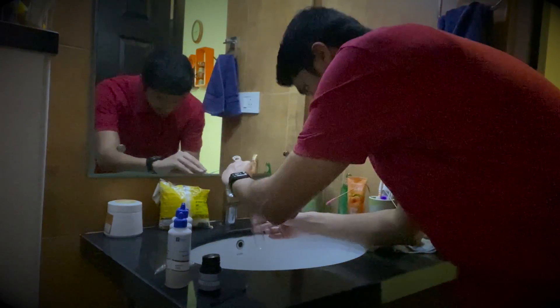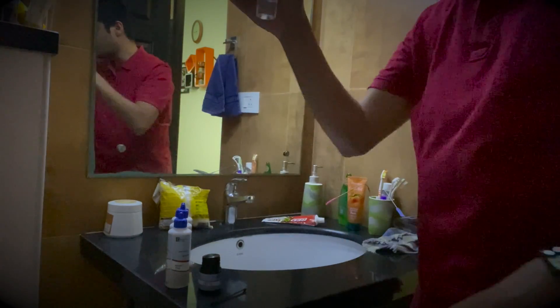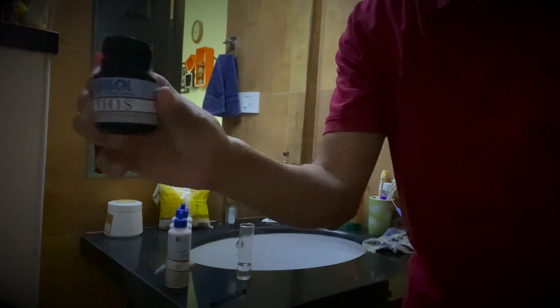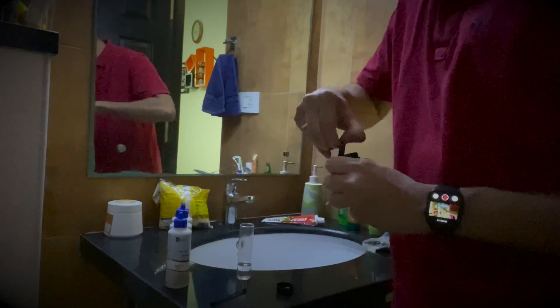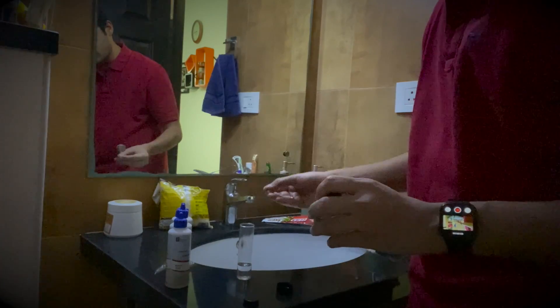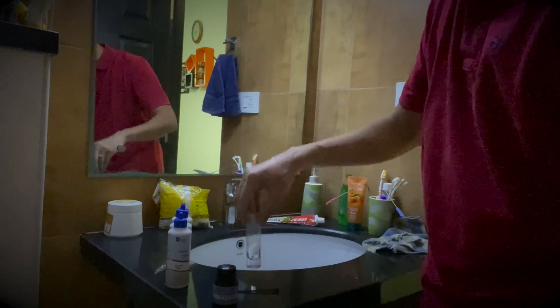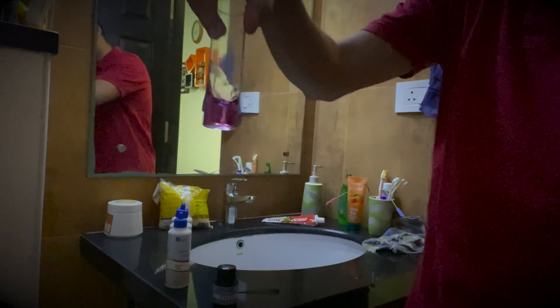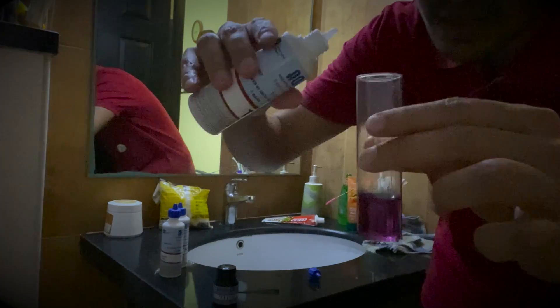To start, we will take 10 ml of water — so this is approximately 10 ml. Once we have that, we need to add one spoonful of TH1S. When I say one spoon, it's a very small spoon provided with the test kit. I'm going to add that into the 10 ml of water, mix it well, and you will see the color changes to a shade of purple. Once this is done, place 10 to 12 drops of TH2 into the mix.